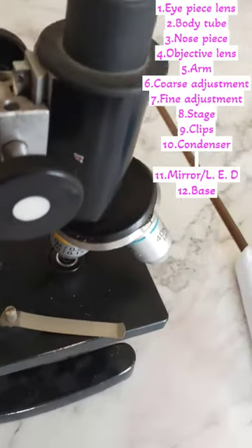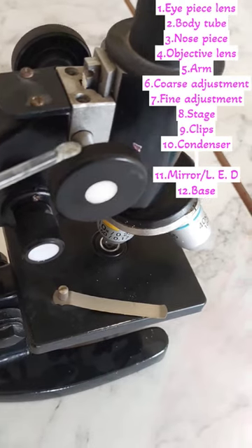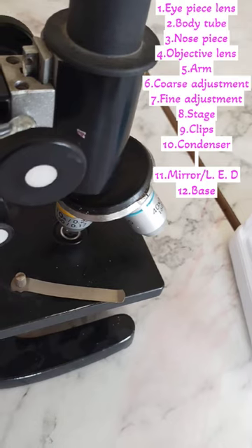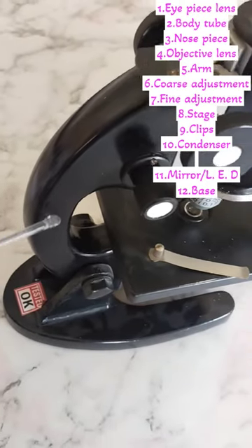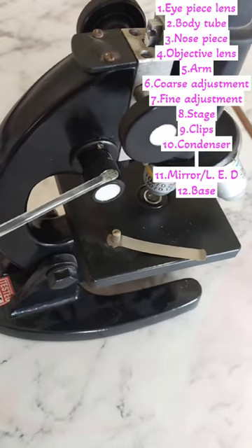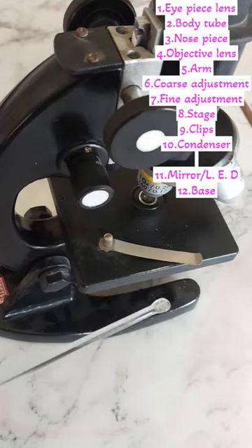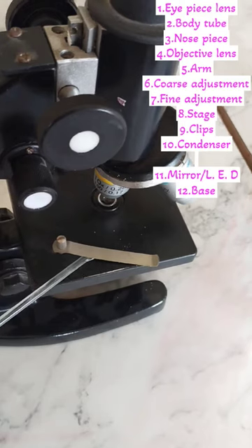You can see that there is a handle known as the arm. In this arm, there are two knobs present — one is larger and one is shorter. The larger knob we call coarse adjustment, which we can use to move the body tube up and down. For fine adjustment, we focus the objective lens exactly on the specimen.